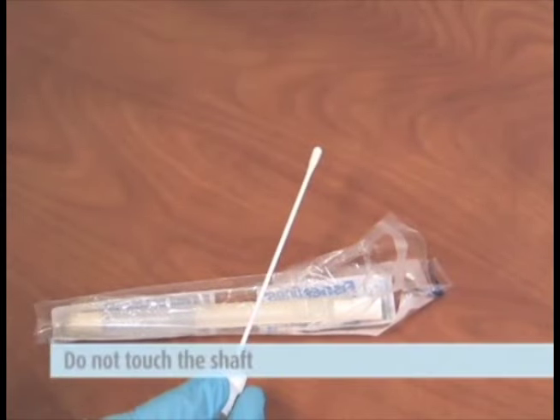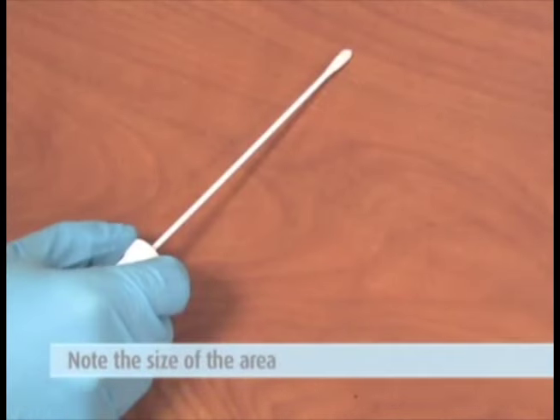Do not touch the shaft. Three, designate a location to be swabbed, taking care to note the size of the area.